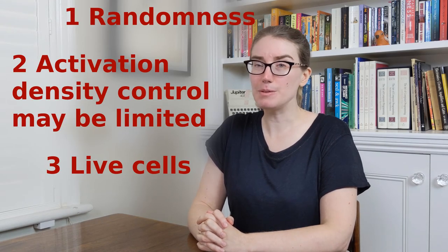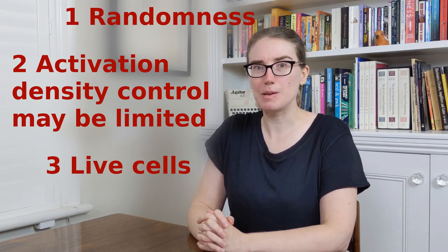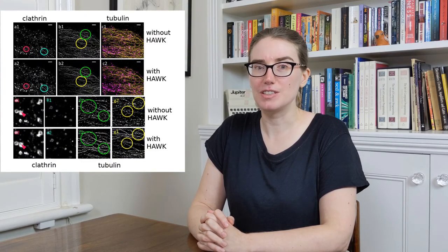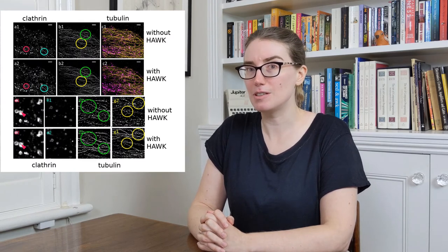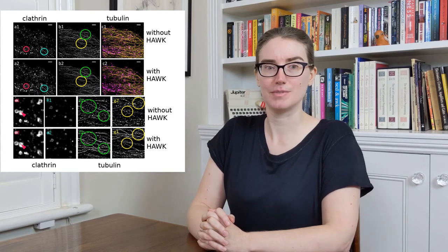Now, back when we were discussing the motivations for this work, I gave 3 main reasons for why you would have to deal with overlapping fluorophores. Randomness is going to be present in pretty much all experiments, but we thought we should be able to do experiments for conditions that people were likely to encounter because of 2 or 3. The classic issue when activation control may be limited is 2-color experiments. We took 2-color data of clathrin-coated pits and tubulin, and you can see marked improvements between our results using a standard algorithm and our results using HAWK.